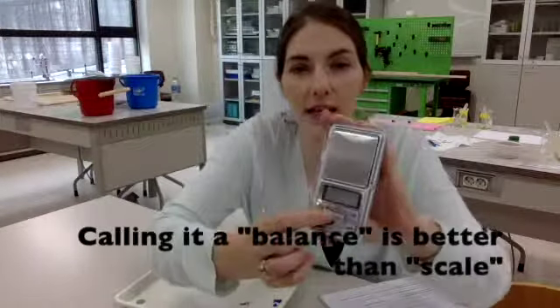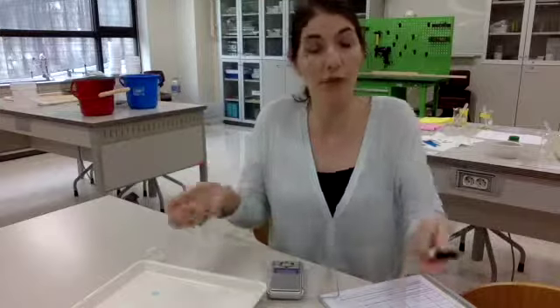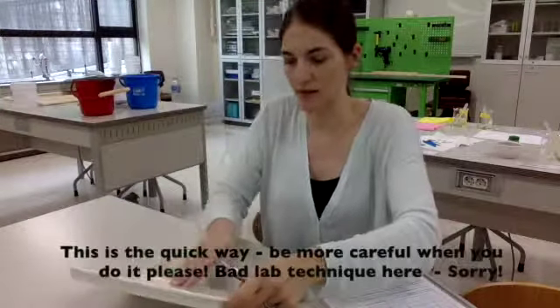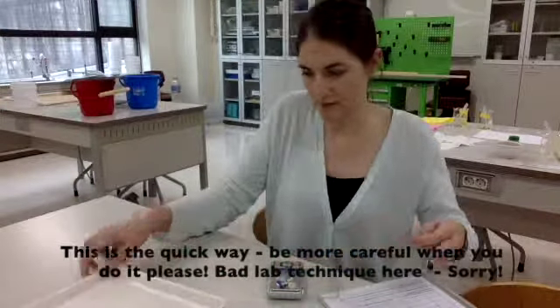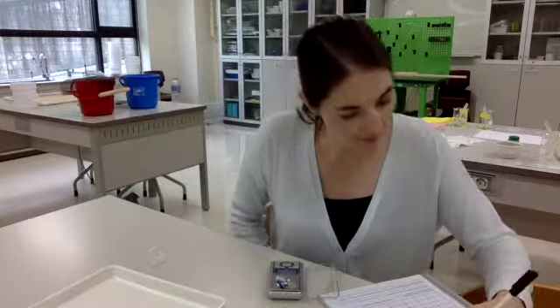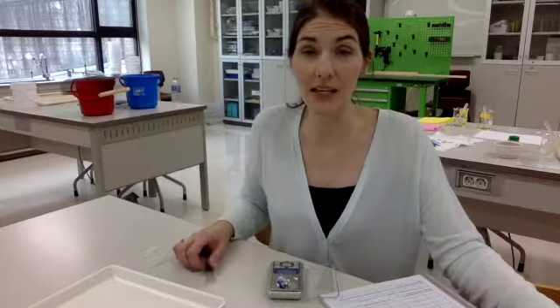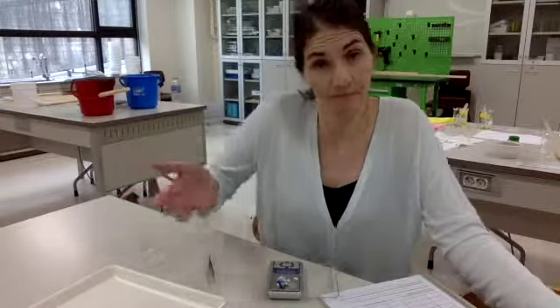To turn the scale on, you just hit the on button. I do what's called taring it, which makes it read 0 before you put anything on it. Okay, so the total grams is 0.4. Yours could be anywhere around that. Honestly, we don't know. We really don't know. No one's ever studied this before.